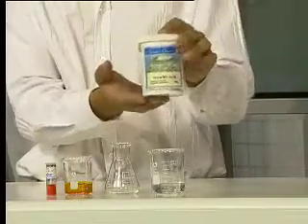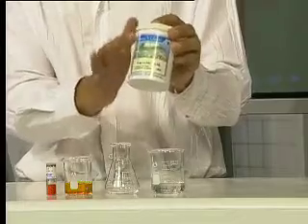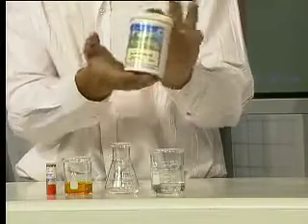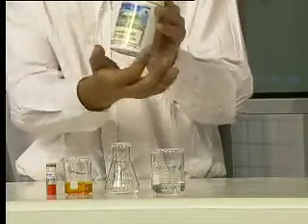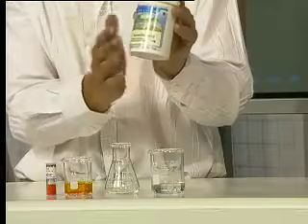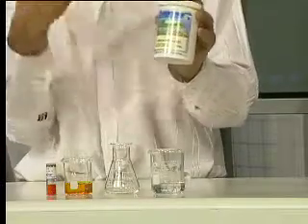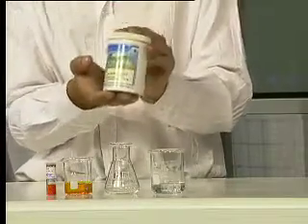I've chosen a rather unusual reducing agent, but it's something that we use in our everyday lives. I hope you take a lot of this every day. This is ascorbic acid, which is more commonly known as vitamin C — something I get from vegetables, specifically from citrus fruits.